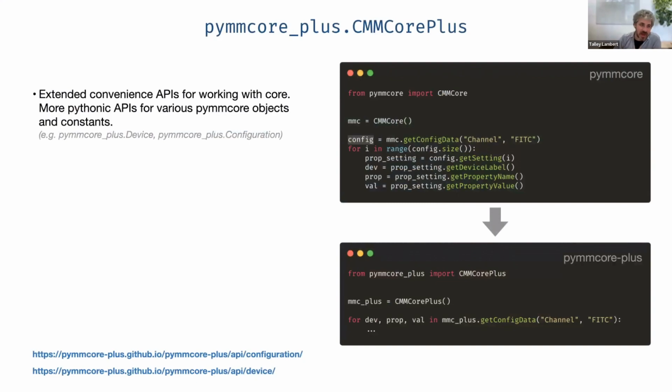So just an example of that, when I talk about convenience APIs for working with core, if any of you have used PyMMCore, you'll know that it very much looks like a C library. So for example, if you had a core object and you wanted to say, tell me what the FITC configuration means, then you might write some code like this. You would say, get me the config data for the channel configuration group and the preset named FITC. And then you would have to, for i in range config size, get the setting, and from that setting, get the device label, get prop name, get value. Very straightforward, but a little bit verbose.